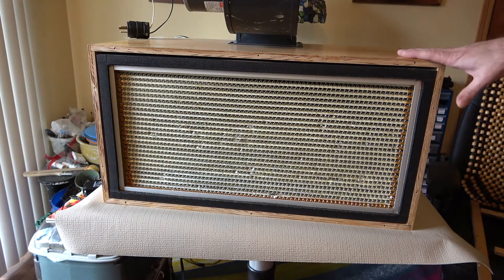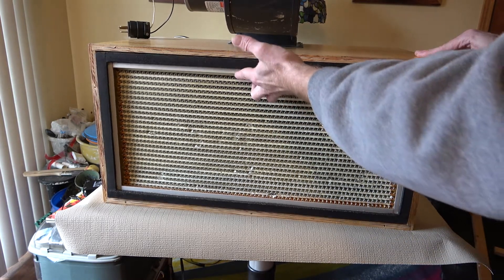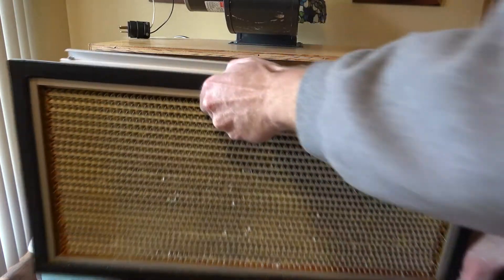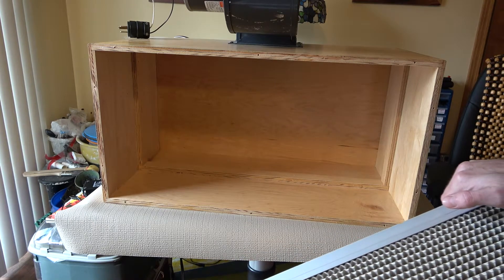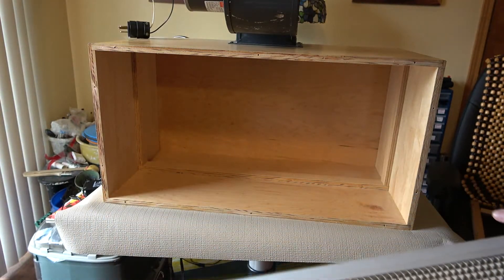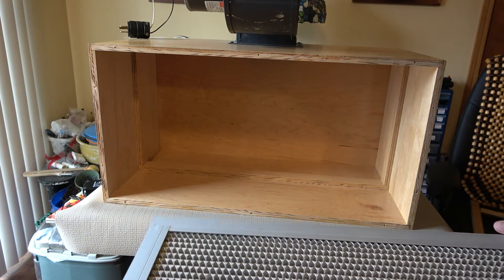I got the frame off — it came off pretty easy. There is no adhesive or anything like that holding it on. You can see the filter is just sitting in there gently too, so really easy to get out. I'll just take this out and... it is surprisingly clean. I guess maybe not too surprising considering that the air always circulates around and cleans itself. But I would have thought there would be some clumps of hair, dust, and debris caught up in there.